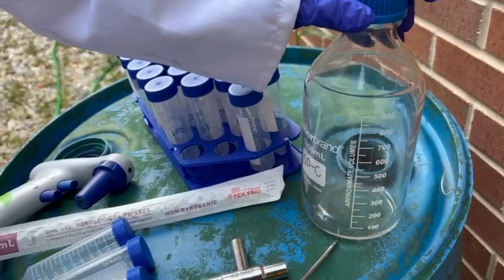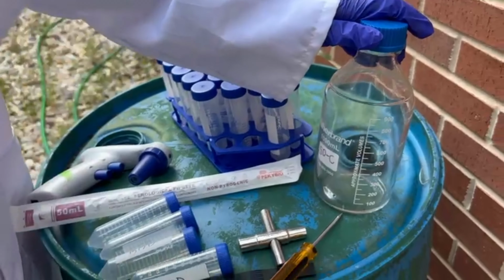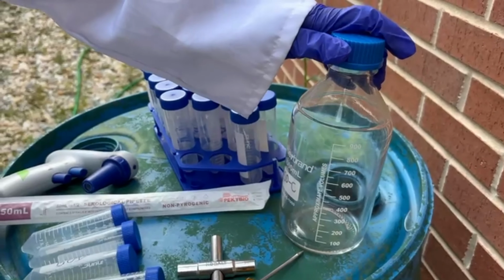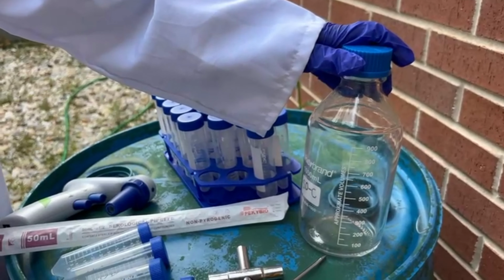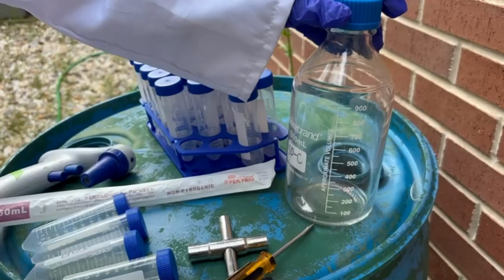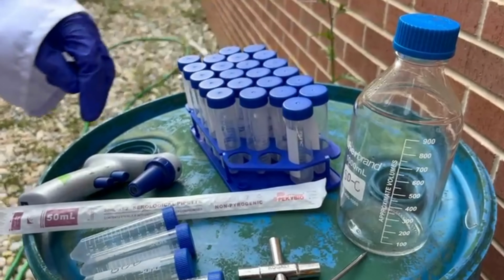So the function of the DI water is, if we are seeing that there is no water coming out from the effluent port, then we'll be using this DI water so that there is some water we can see coming out from the effluent port. That is the main goal of this DI water.